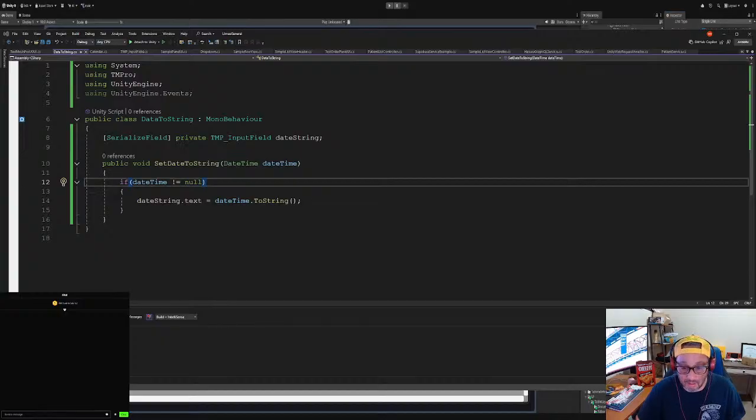And then we want to add the date time thing to it. Date time to string. Where is it again? Okay. All right. Date time to string. There we go. And then we need to change that to input field, which we did. Okay, we got that right. And then we go to the calendar, which is over here, references, events.